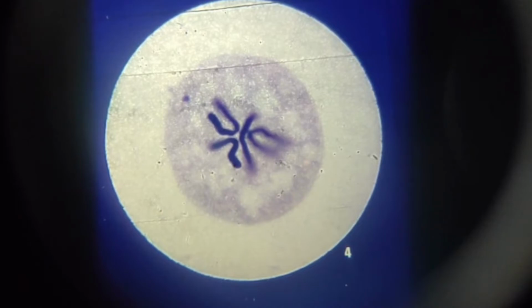That is, from one pole through the equatorial plate to the other pole. The 4 chromosomes are seen as they lie flat on the equatorial plate. Look back at slide 3. You can see the chromosomes from the side. The centromeres, which are not visible, would be near the center of each chromosome.